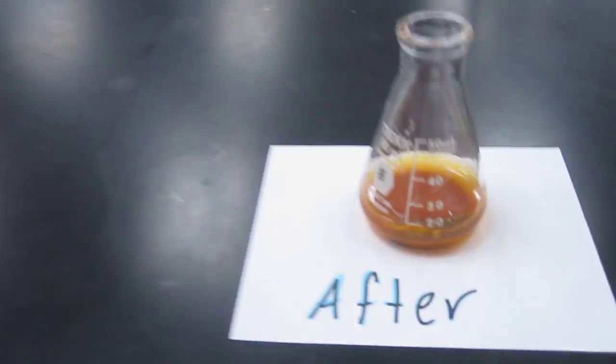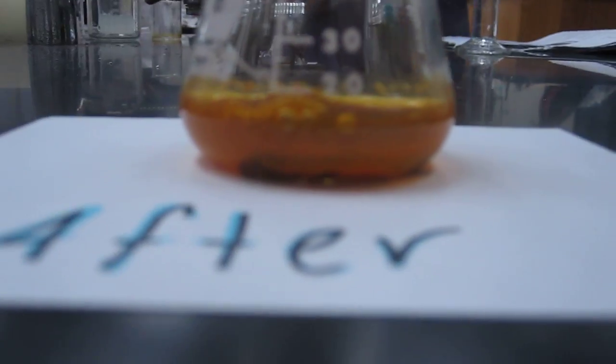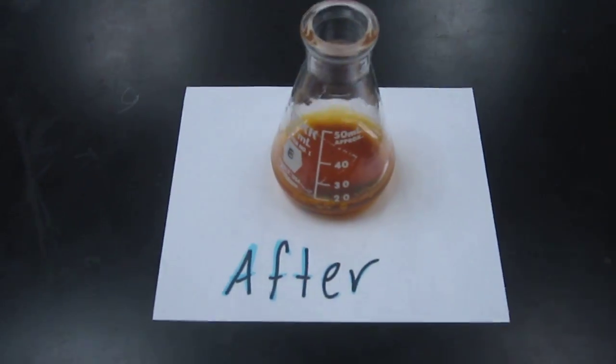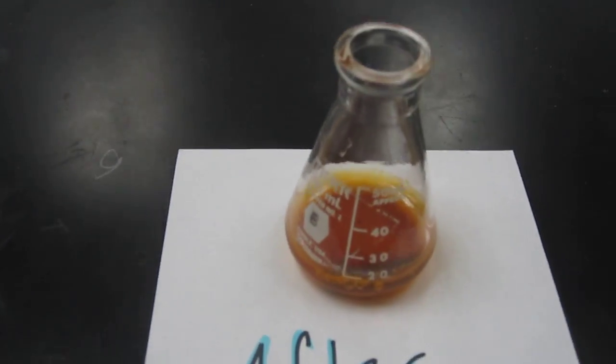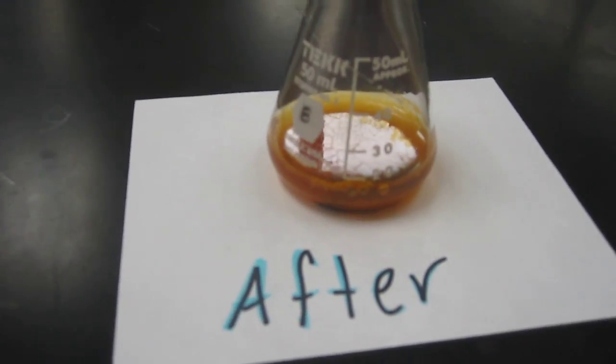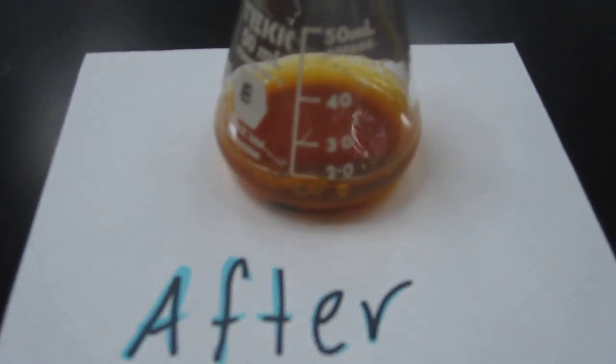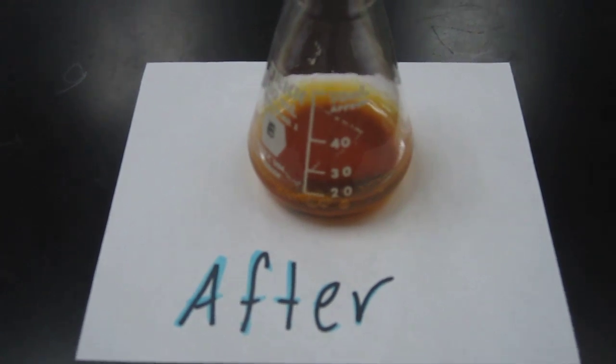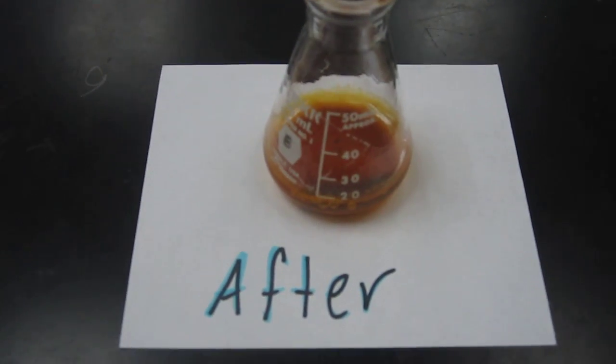Now, after a day, you see the difference in the solution. The solution is no longer green or blue, it's brown. And the nail is not very easily seen, but it's got copper all over it.